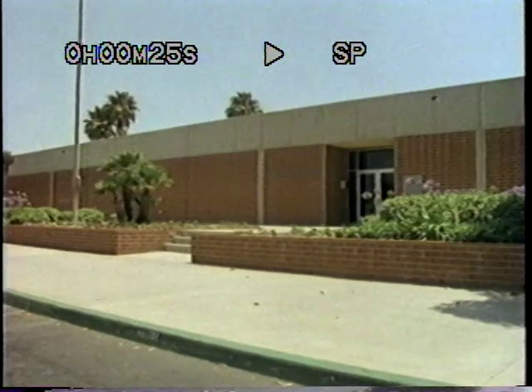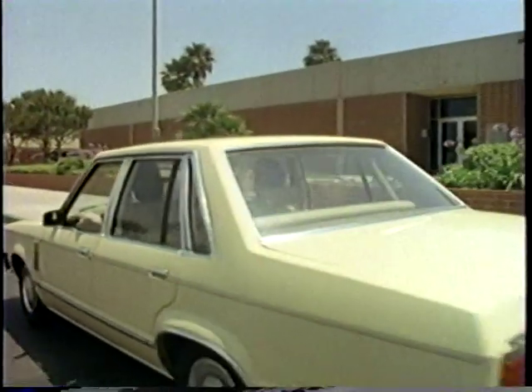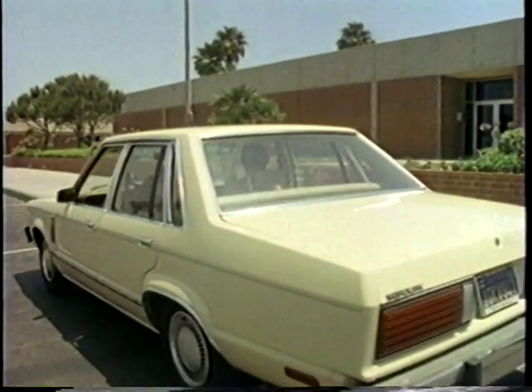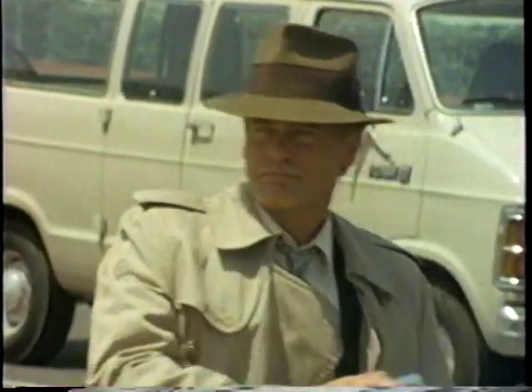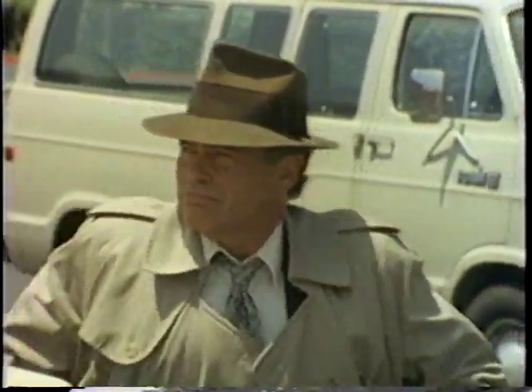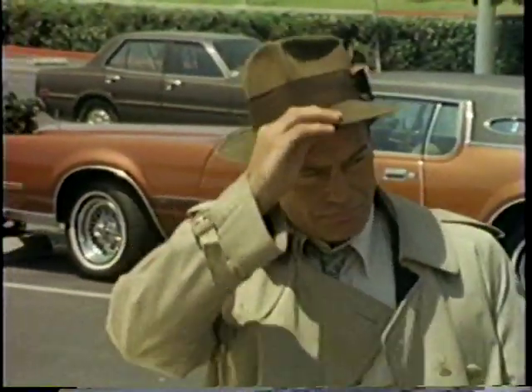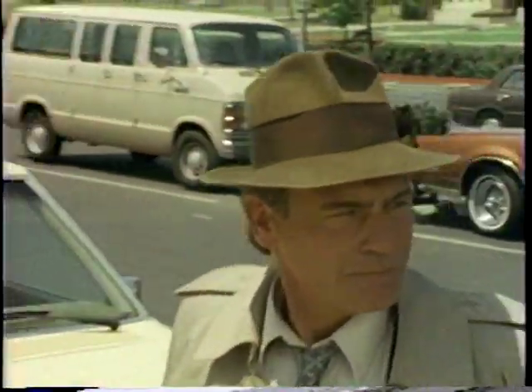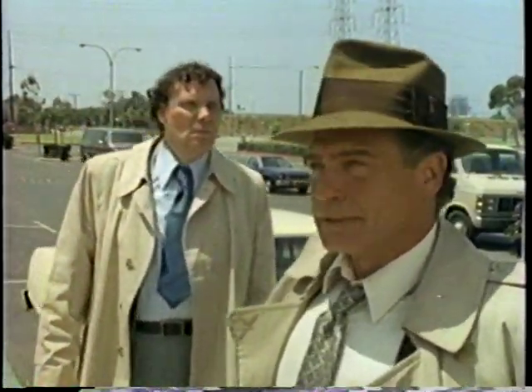Some kid had gotten hurt at Jefferson High School last week, and of all places, the chemistry lab. My partner, Bruno, and I were conducting the follow-up investigation. My name's Grumman, and I have to admit this is the first time I'd ever been called into a high school chem lab. But I have investigated my fair share of accidents, and one thing I've learned is that there's nothing accidental about them. Somebody goofed. Let's go, Bruno.